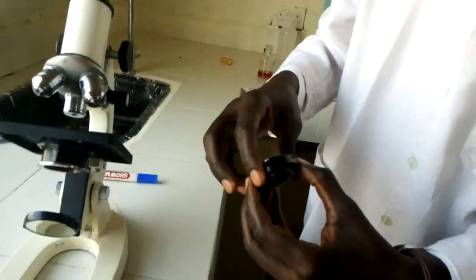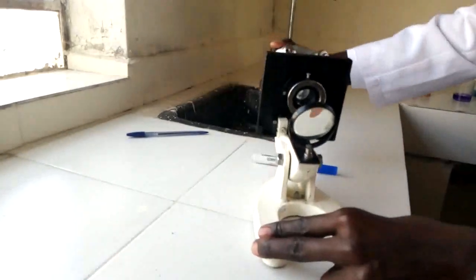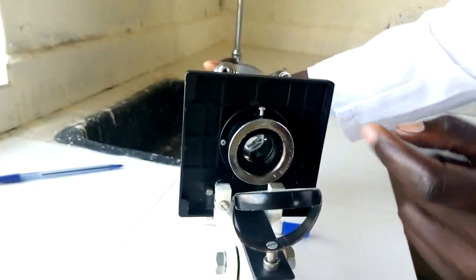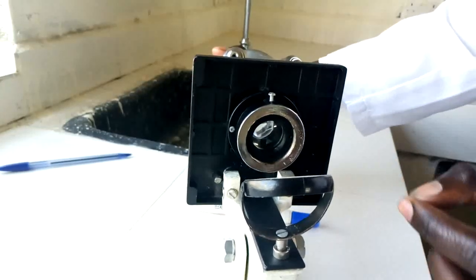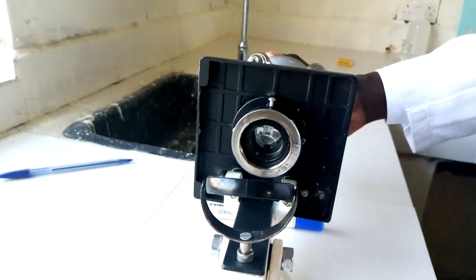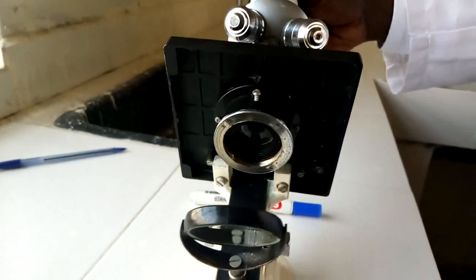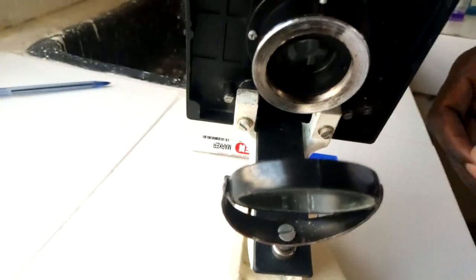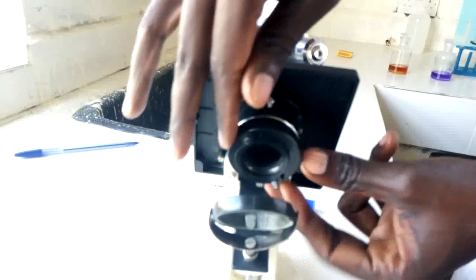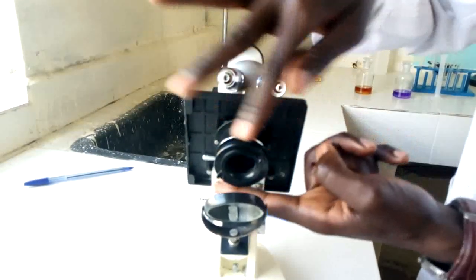If there is not enough light, the diaphragm can be fully opened to allow enough light to pass through to the condenser. The condenser is found inside here and comprises some lenses capable of concentrating light into a strong beam. When light is reflected from the mirror, it goes to the condenser where it is concentrated into a strong beam, enabling enough light to reach the stage for clear viewing of the specimen.